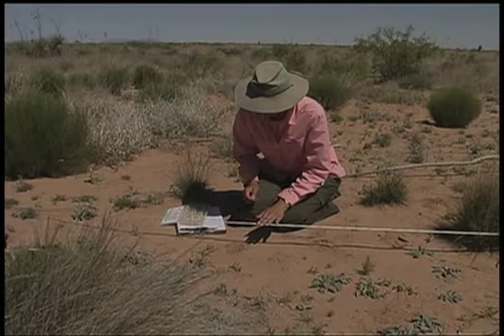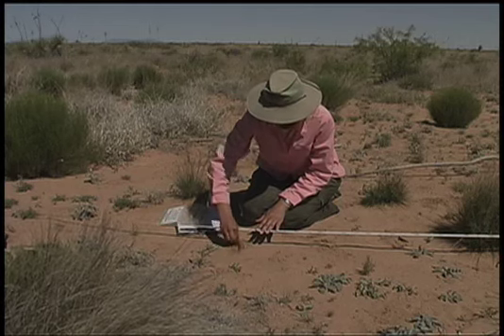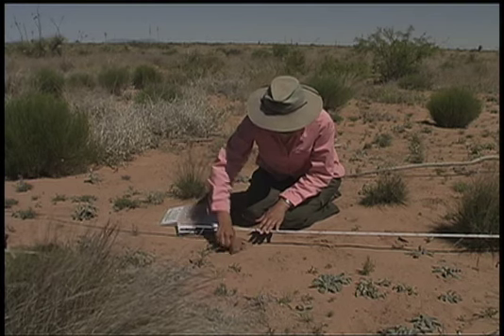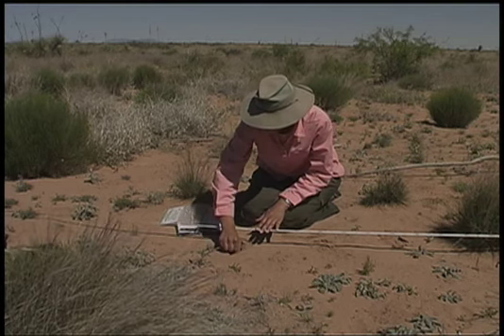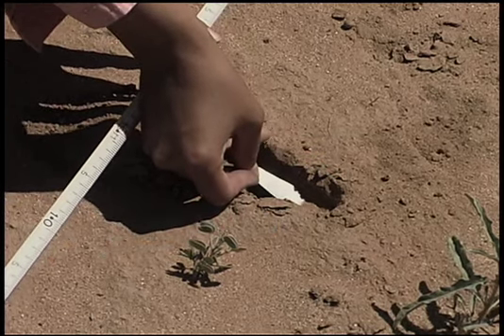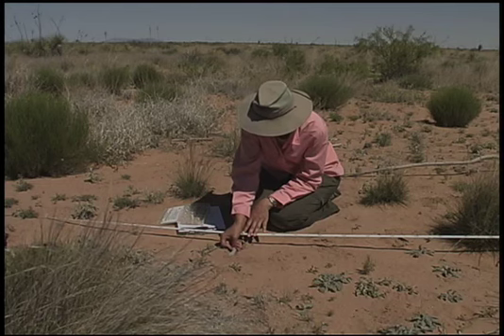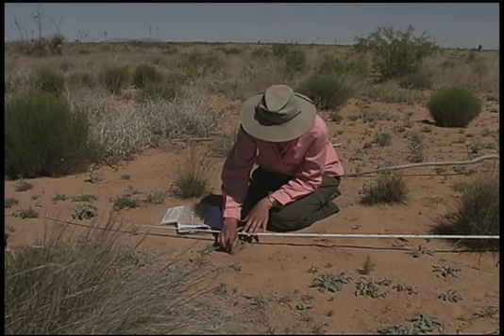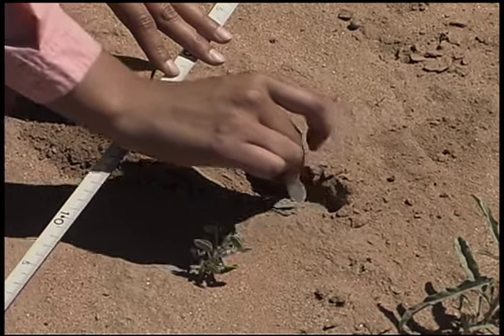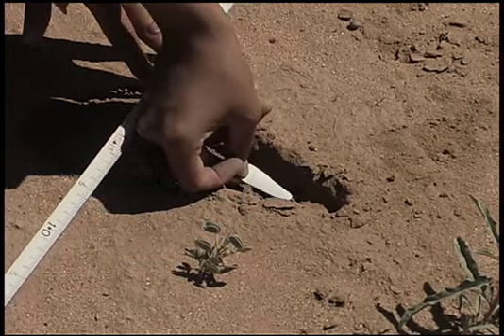To take the subsurface sample, excavate the trench to approximately 5 centimeters. The subsurface sample should be directly below the surface sample. Carefully dig down to a depth of 20 to 25 millimeters until a shelf is formed. Again, take the scoop horizontally.